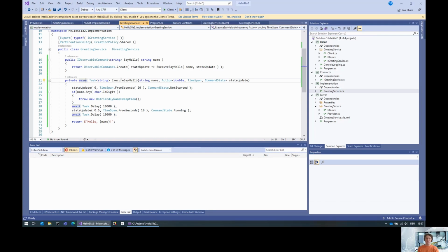You typically use a method or the async and await pattern, and basically get delegates to issue state updates or issue intermediate results at any point in time.